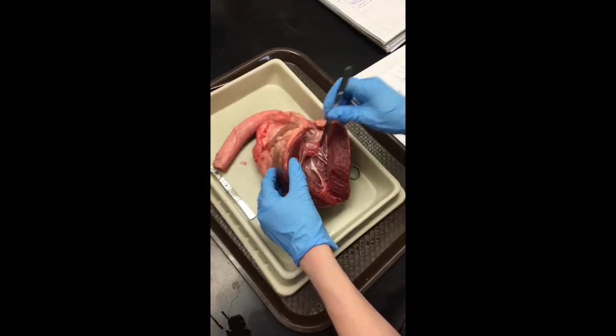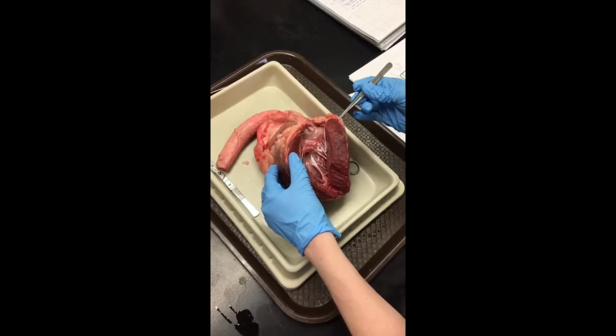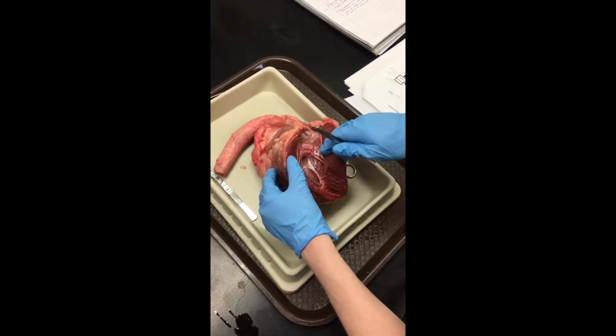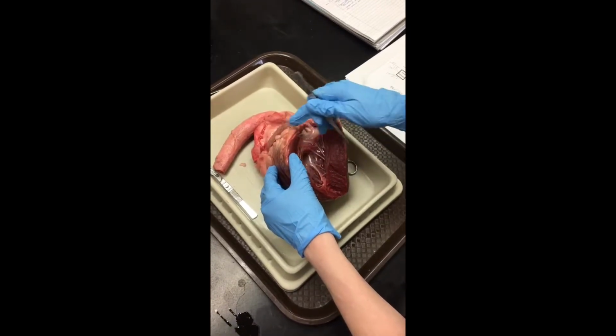Alright, this is the left ventricle in here, and it's a large chamber which allows the walls of the chambers to expand and contract, and it contracts in order to pump blood through the body. The ventricle relaxes and fills up with blood again after this. It receives oxygenated blood from the left atrium, and it goes up through the aortic valve.